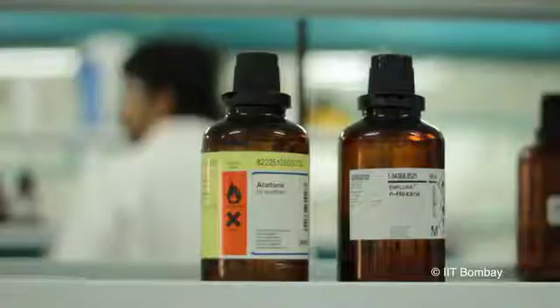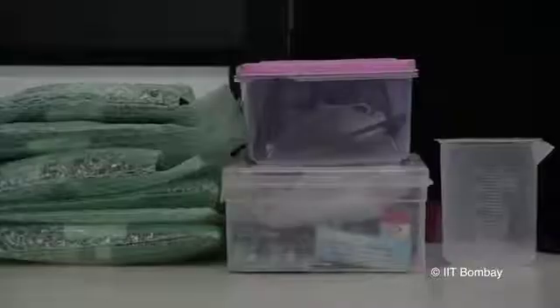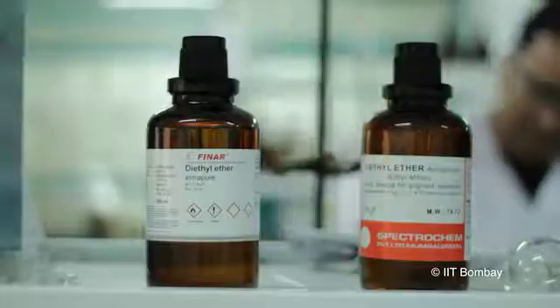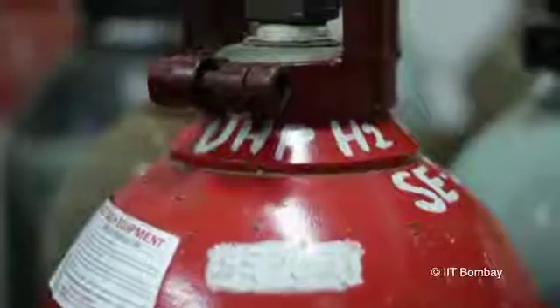We will now see some common fuels present in laboratories. Fires caused by wood, paper, plastics, and rubber are classified as class A fires. Flammable liquids are commonly used in research laboratories and are classified as class B fires. Fires caused by flammable gases like hydrogen, methane, etc. come under class C fires. Metallic fires are classified as class D fires.